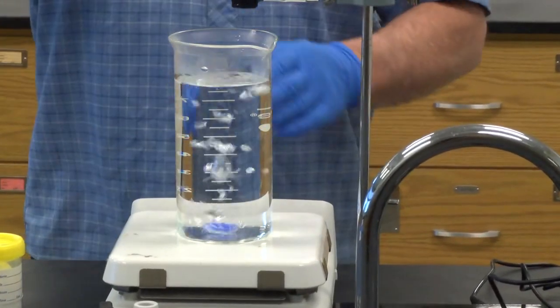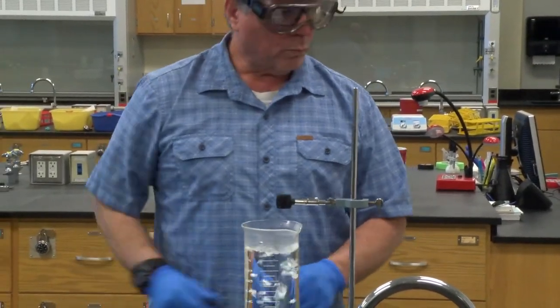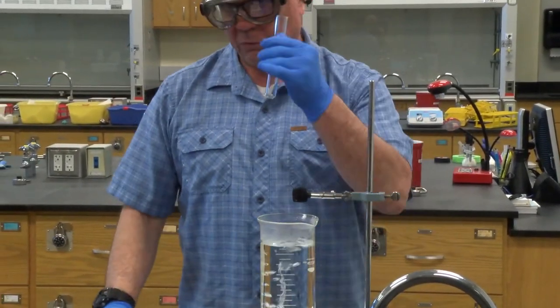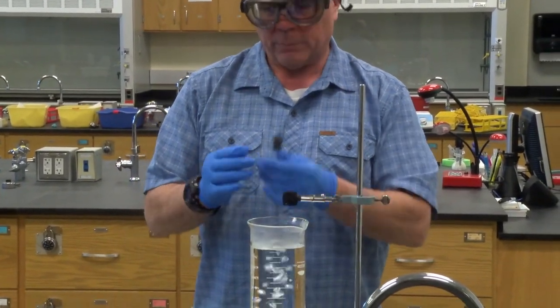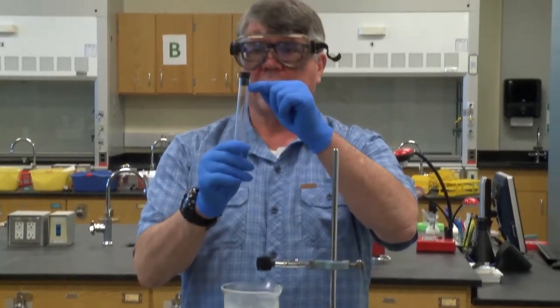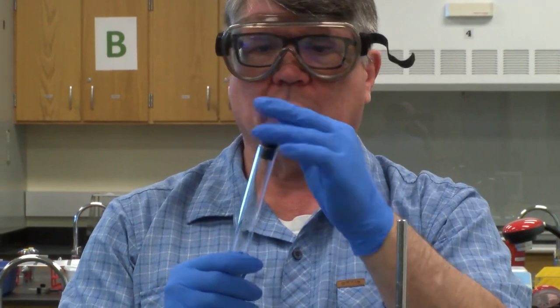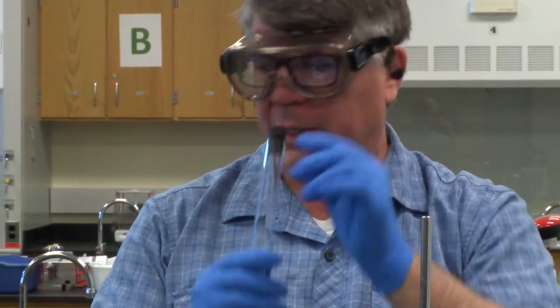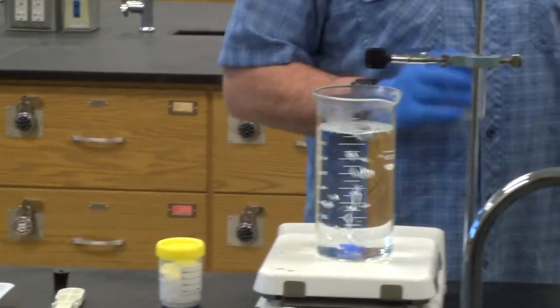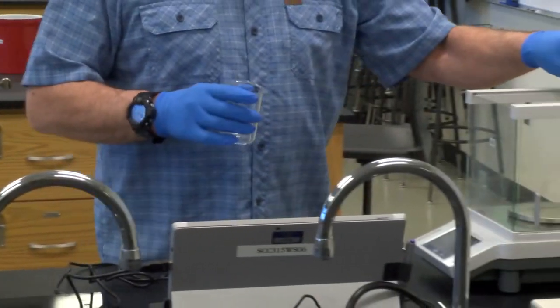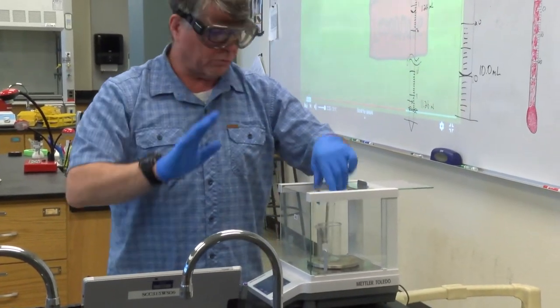As that's going, you're going to take a large test tube from your locker, the solid organic solvent. And what we do is we're going to weigh out some of the solvent into here. And the amount that we're going to weigh out is enough so that it comes up to the bottom of this stopper. This is a one-hole rubber stopper, fits in here, and we want to get as much of that solvent in there as we can. So to do that, and we need to know how much the solvent weighs by itself. So what we're going to do is we're going to put the empty test tube in the beaker on the balance and tare it out. We don't care how much those weigh.